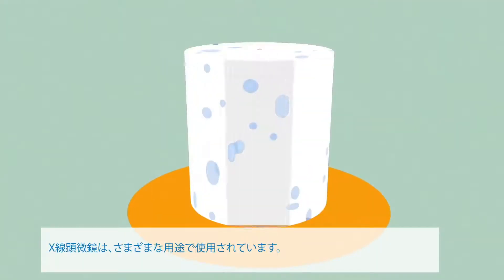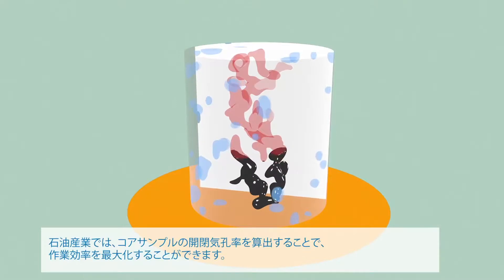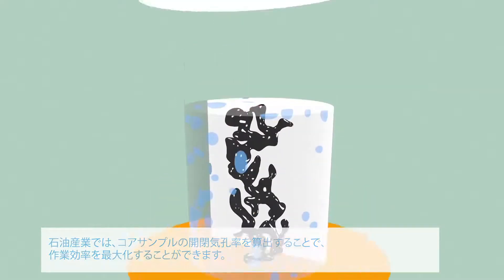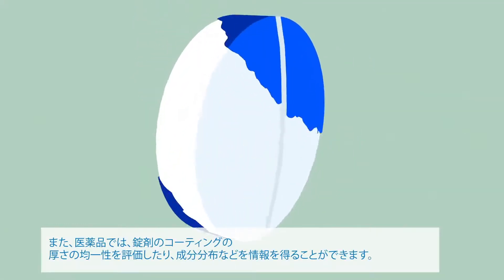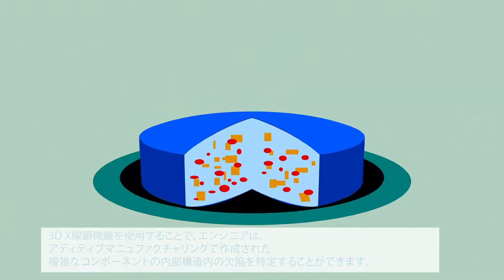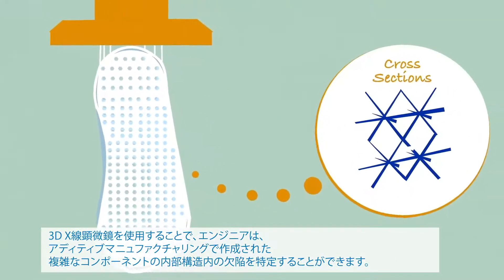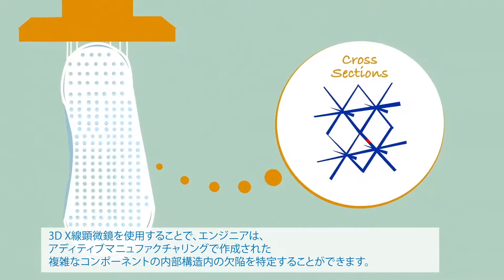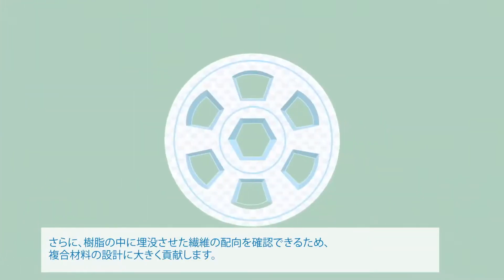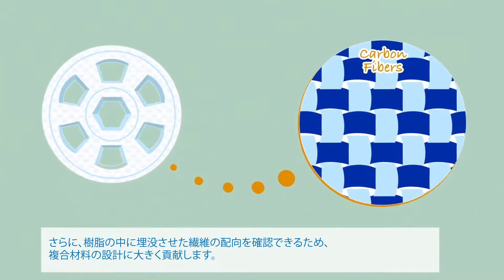X-ray microscopy is used across a wide variety of applications, from maximizing well efficiency by determining the open and closed porosity of core samples in the petroleum industry, to measuring the homogeneity of pharmaceutical coating thicknesses to dial in API uptake rates. Using XRM, engineers can identify defects within the internal structure of complex components created with additive manufacturing, or maximize the performance of composite materials by verifying the orientation of fibers buried in the resin.